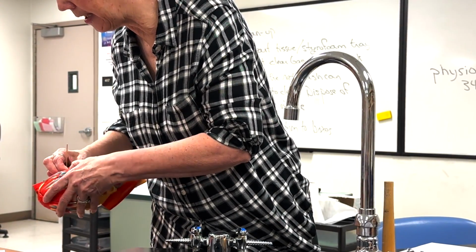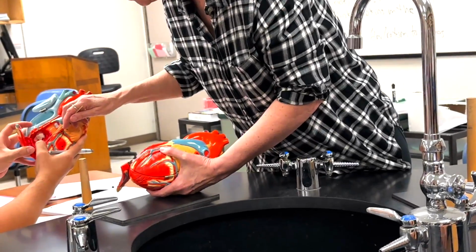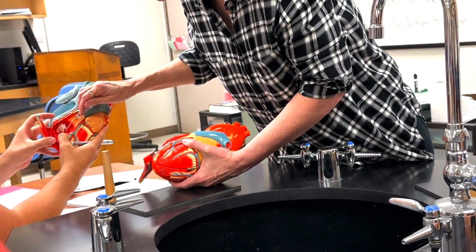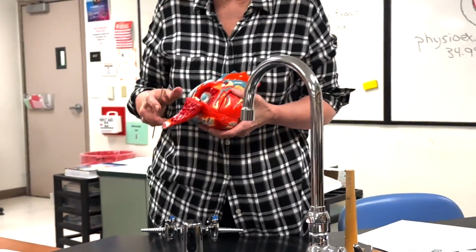And on the left side, my question on here is why is the chordae tendineae the same number as the papillary muscles? I have no idea. Well, it's pointing to this, this would be the chordae tendineae here, the white. Oh, so it should be labeled out there. Yeah. Oh, okay, gotcha. All right.